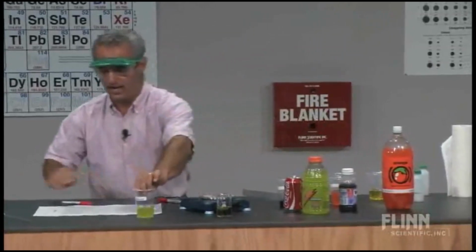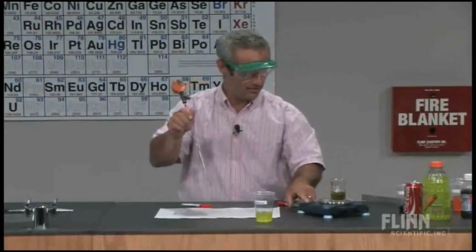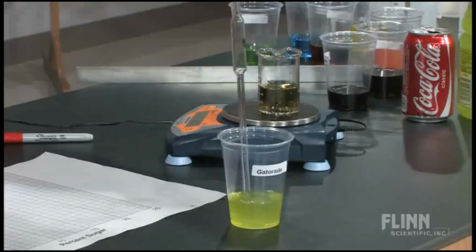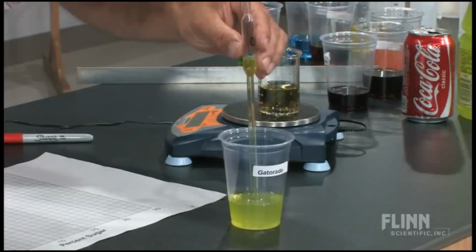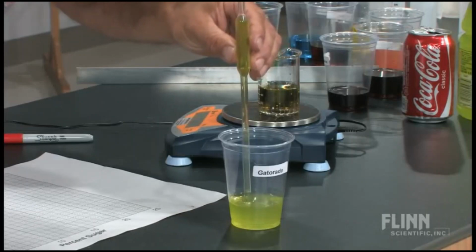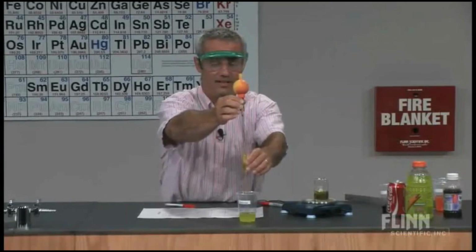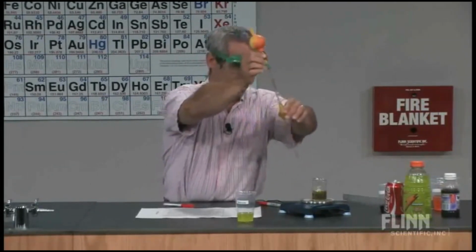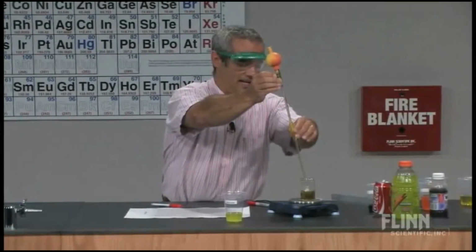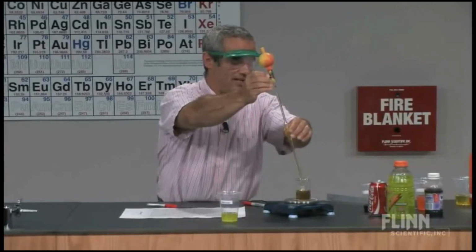Let's try Gatorade first. Okay. We don't even have to empty that beaker yet. We still have room there to zero it. Drop some Gatorade. You can make your predictions where it's going to be. And not only can you tell the hierarchy, which one's the highest sugar content, you can get a value for that concentration of sugar. How many grams of sugar dissolved per 100 grams of the beverage? Okay. And our Gatorade, you want to make an extra line there or off to the side maybe? Gatorade.